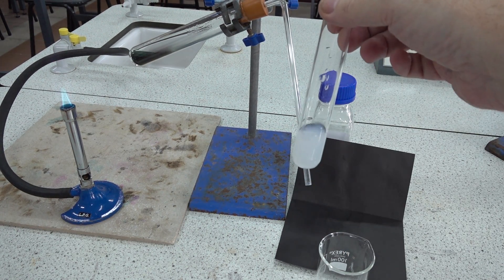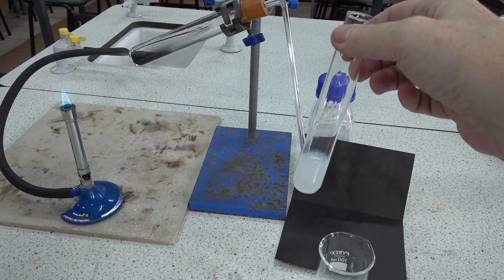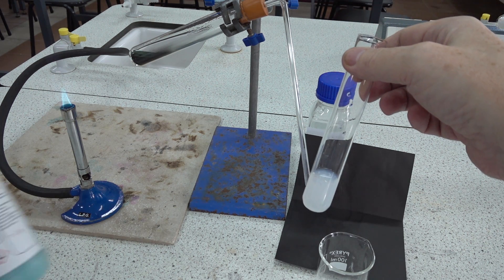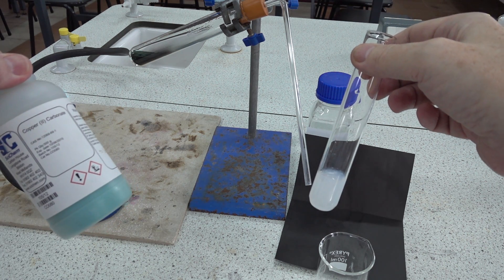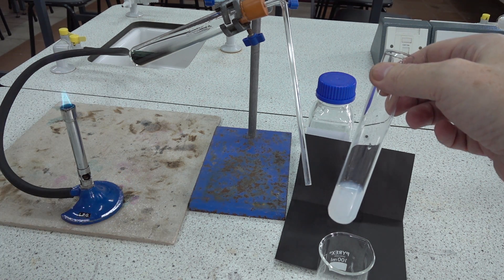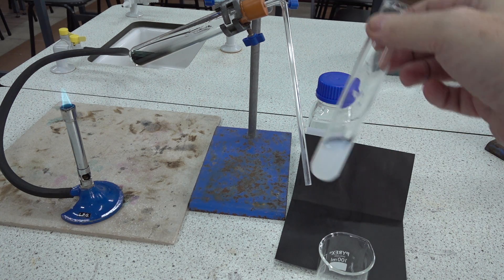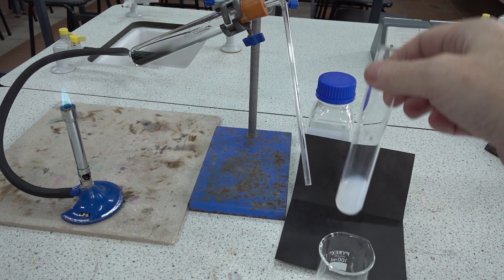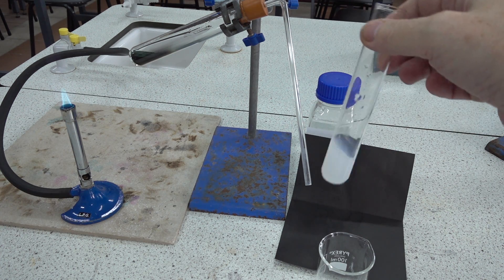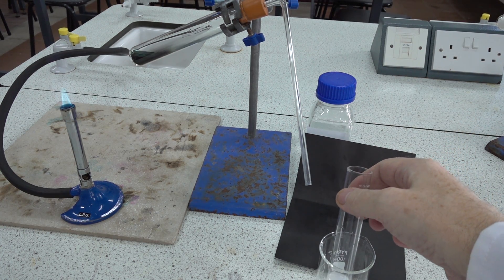So again, thermal decomposition — this time of green copper carbonate. Again we've got the characteristic milky white colour of the limewater.